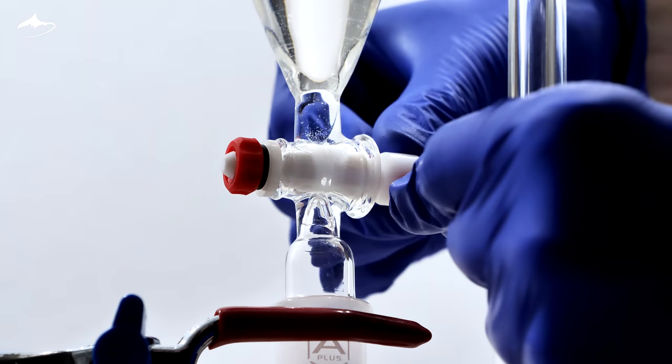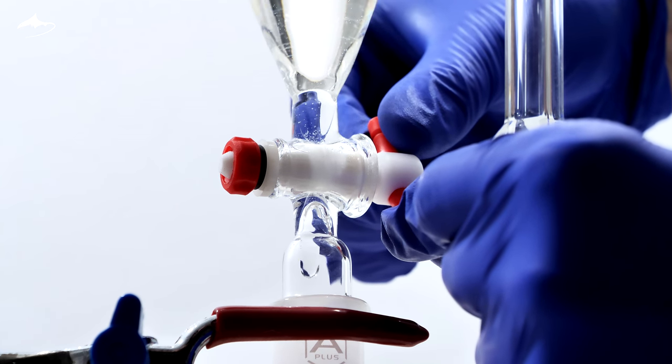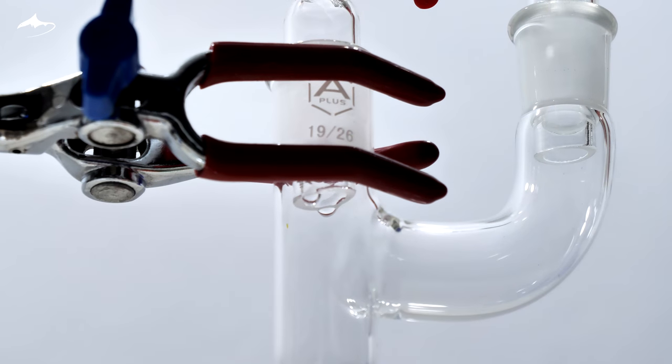Let's start the reaction. The dropping funnel is adjusted to deliver one drop every 2 seconds. This is key in order to control the reaction.